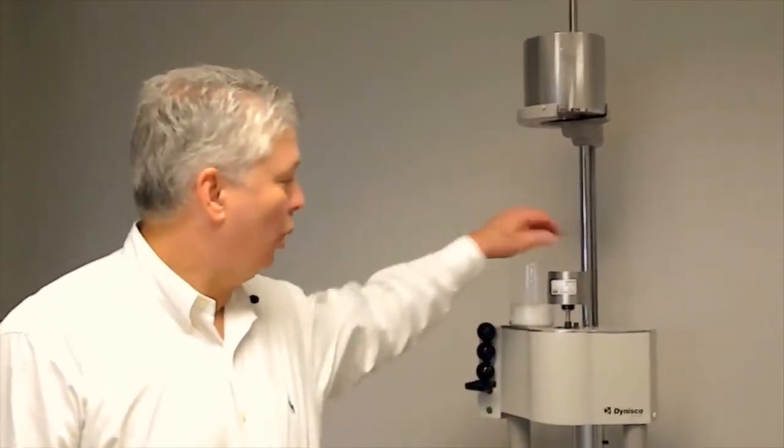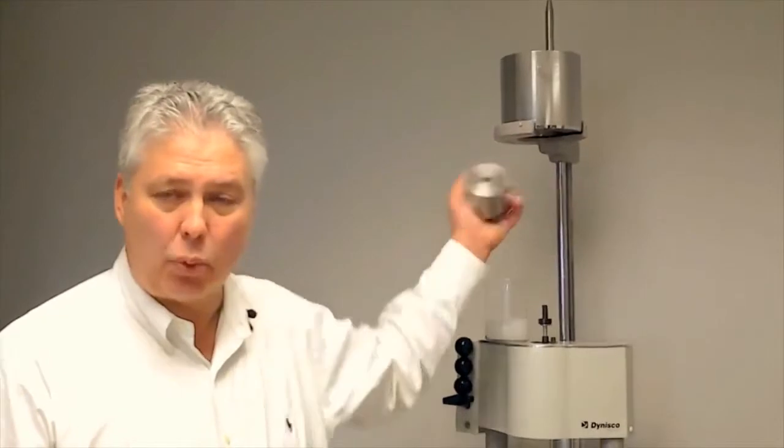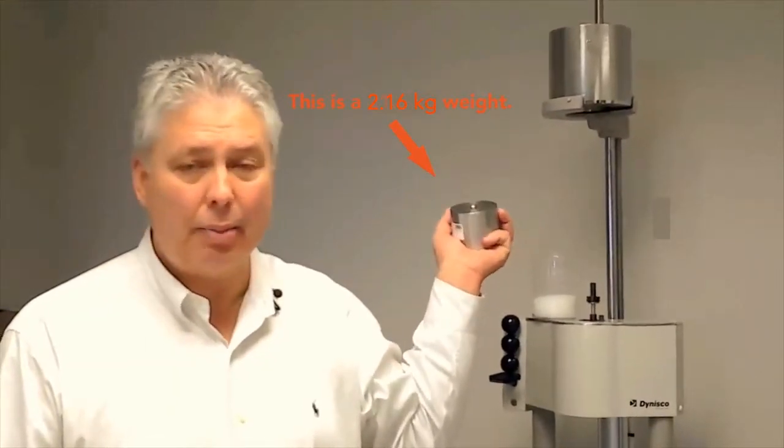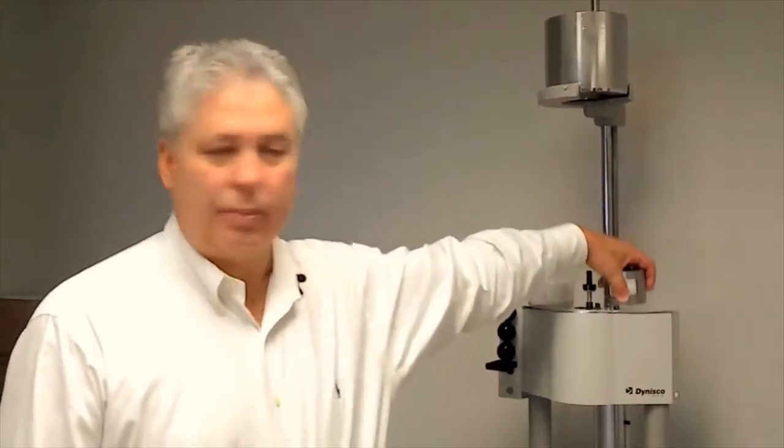So in order to get a meaningful sample, what they had to do was increase the weight. They went from 2.16 kilograms to 21.6 kilograms to get a more meaningful sampling.